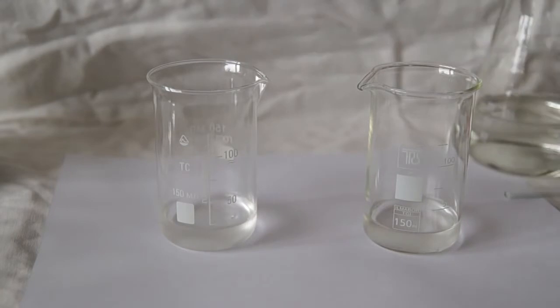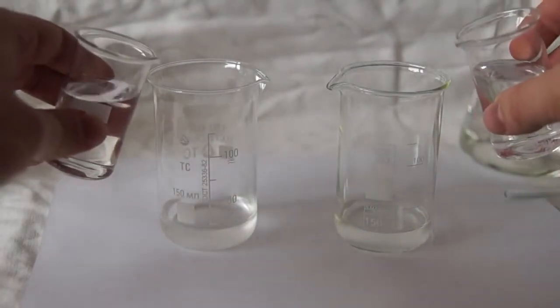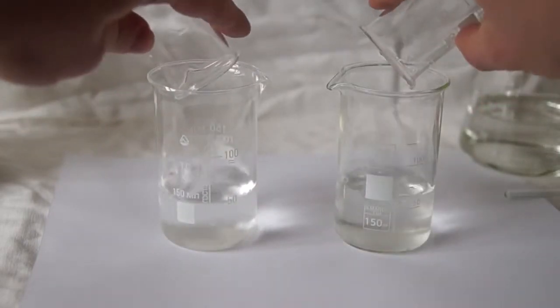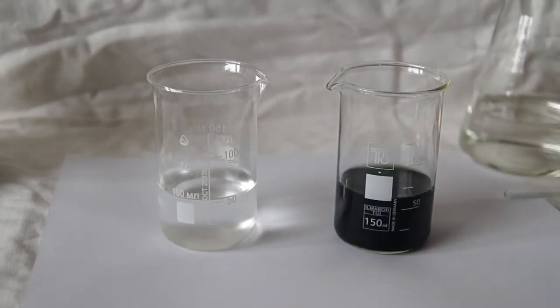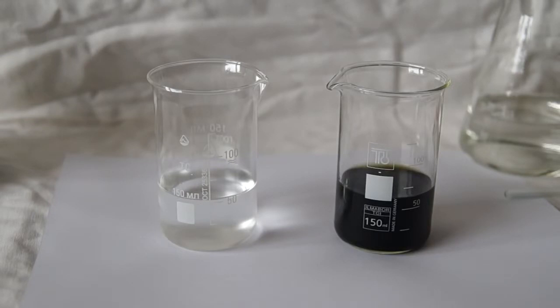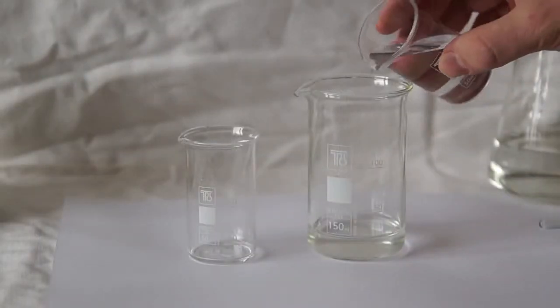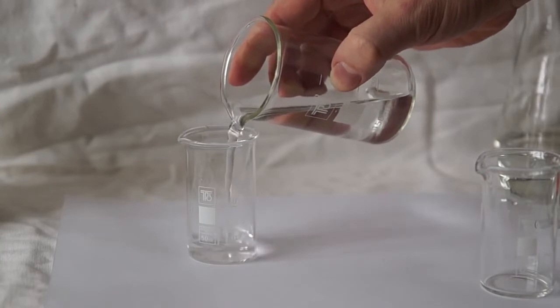Now, however, the second solution is at a different concentration and the reaction time can change. One, two, three — mix solutions. The first solution reacts rapidly, but the second one takes a bit longer. This reaction is quite beautiful and spectacular. You can play with it long enough.